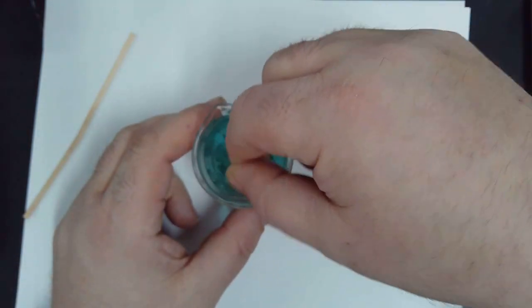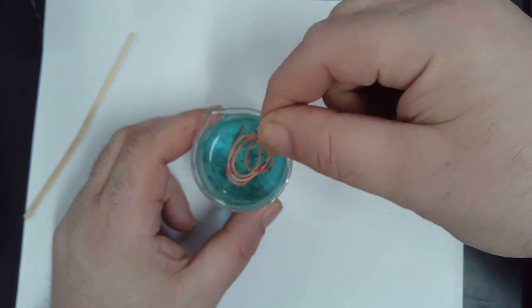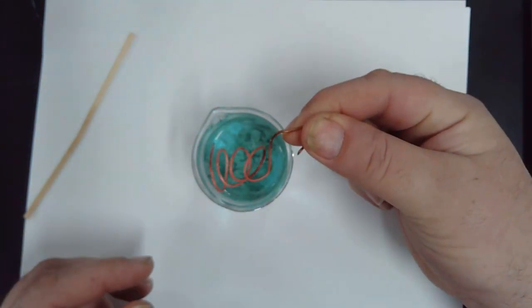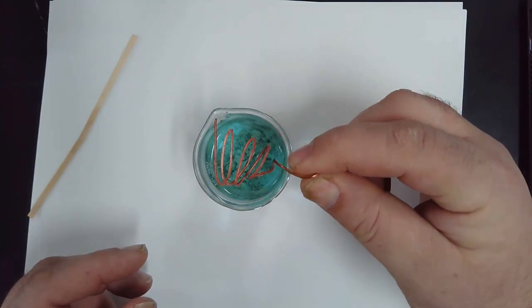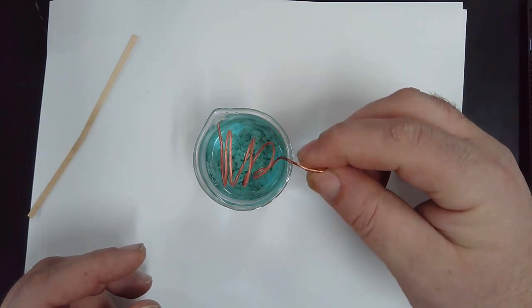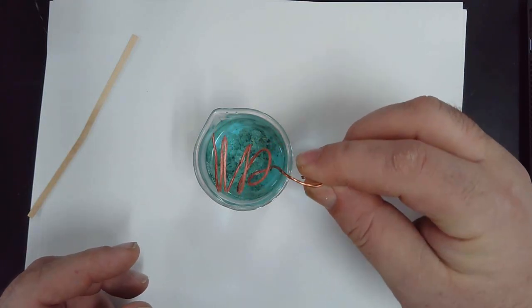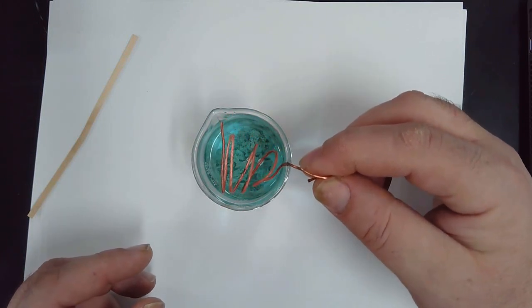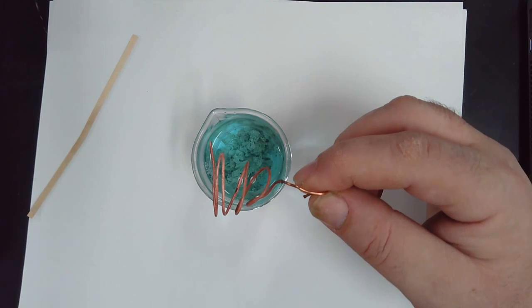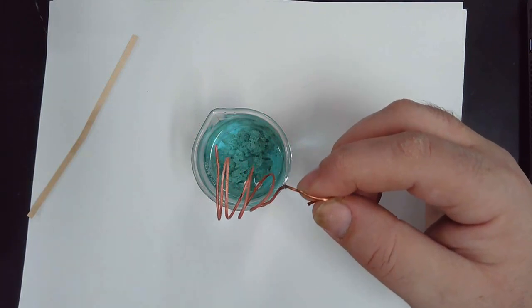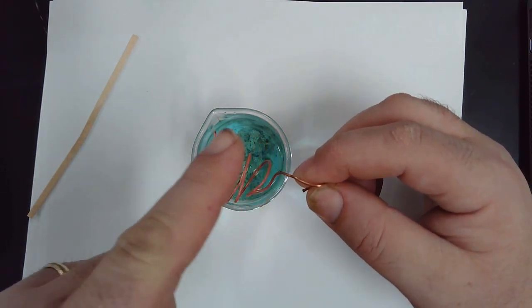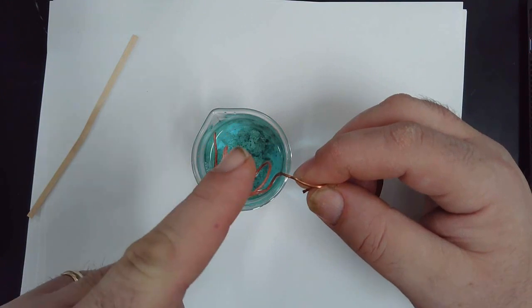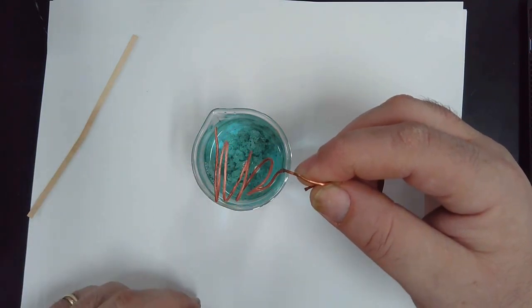What you should notice is I've taken just about everything off of this piece of copper. Once you've taken everything off of this piece of copper, you will then take a distilled water bottle and rinse all of the noticeable pieces of the silver off of this.